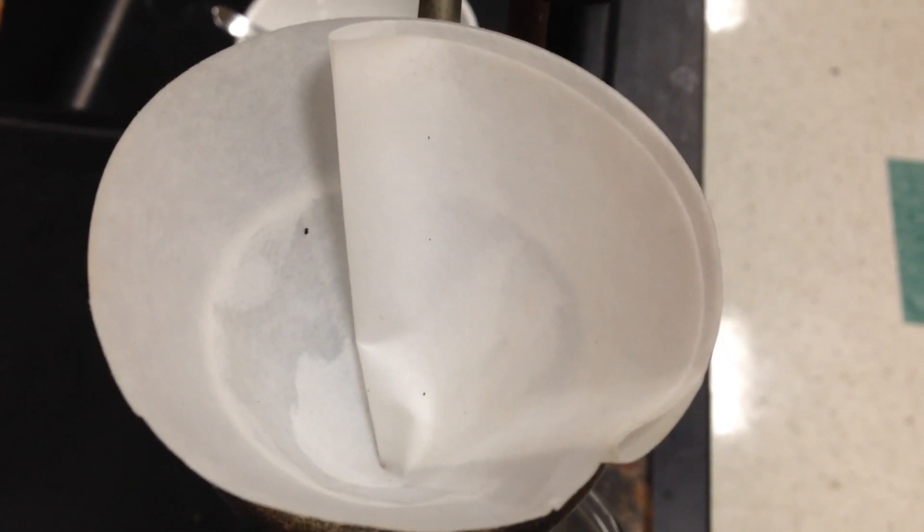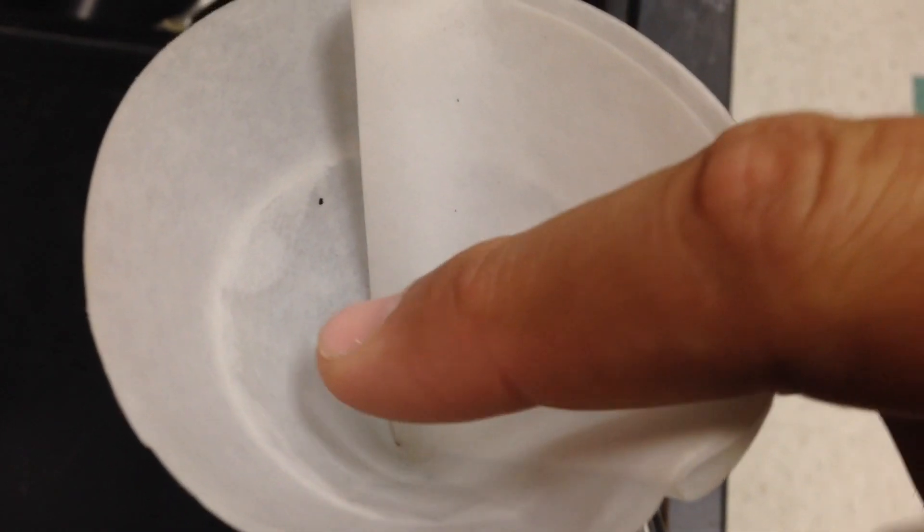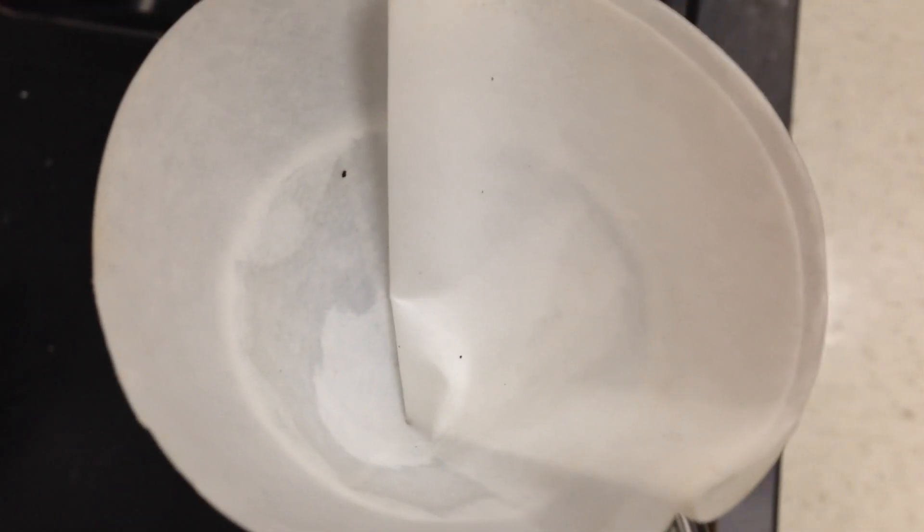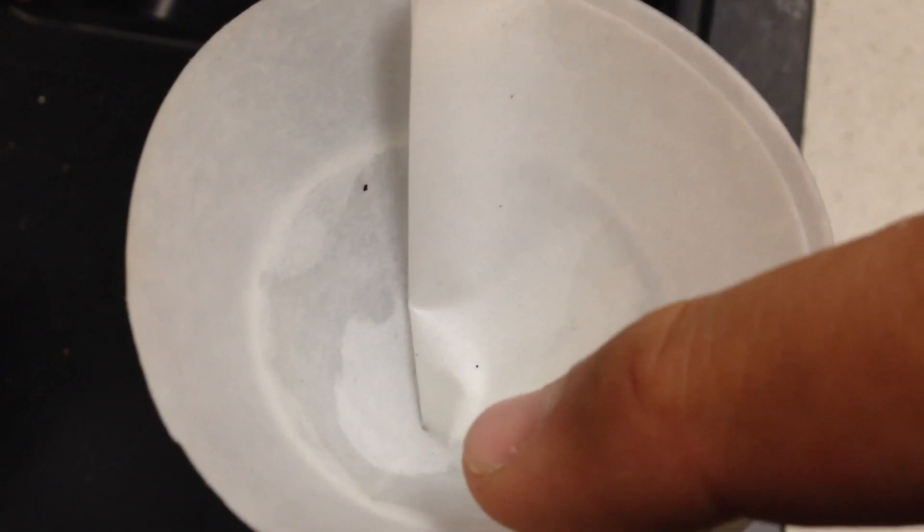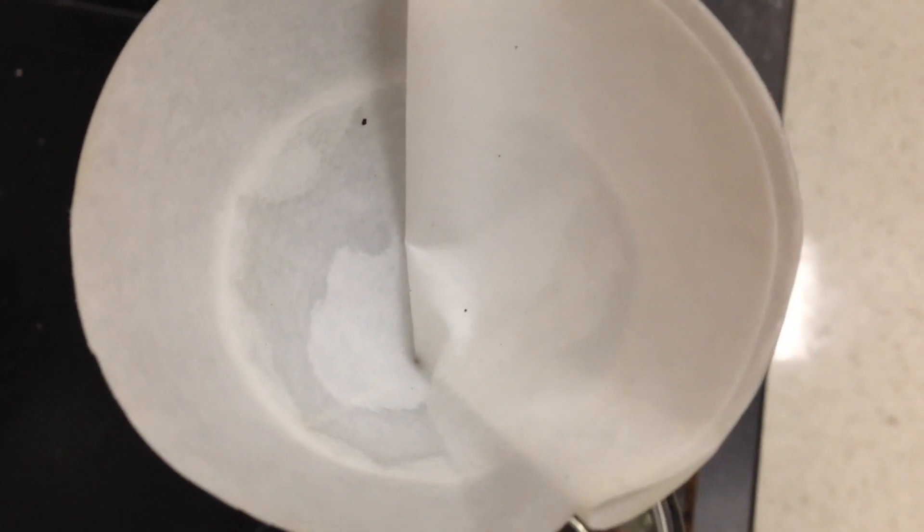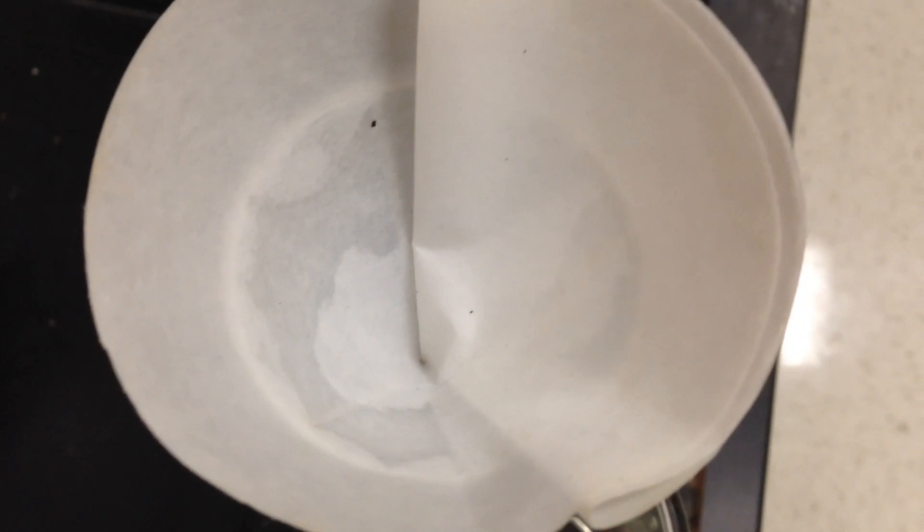Coming back two hours later, you may look at your filter paper and say, 'Well, it looks like very clearly this ring is sodium chloride,' and it is. You may be first to suggest that maybe this filter paper does separate some ions since I see some sodium chloride. But this is not the result of filtering the ions out of the water. This is the result of water that was left in this filter paper evaporating.